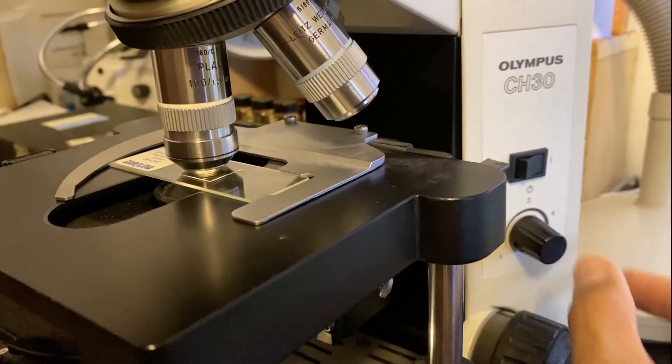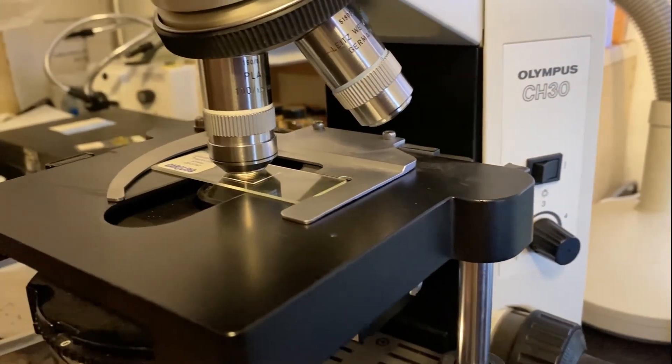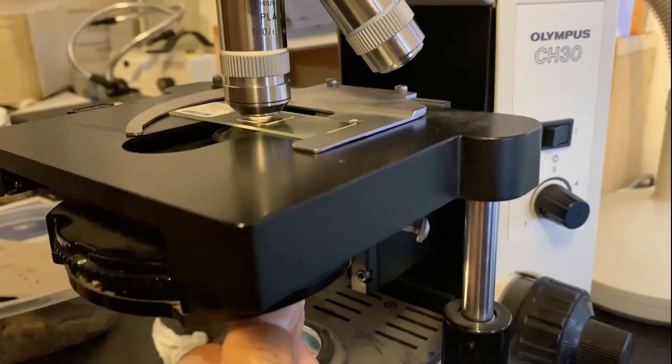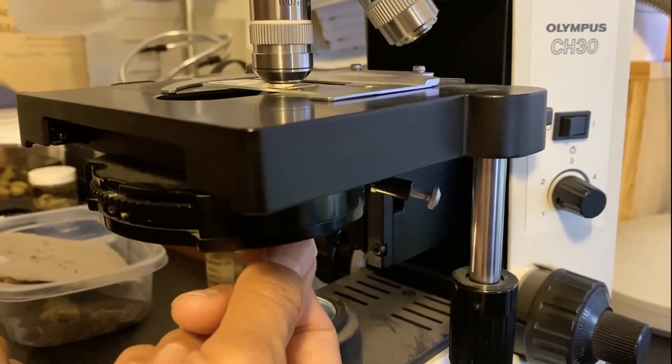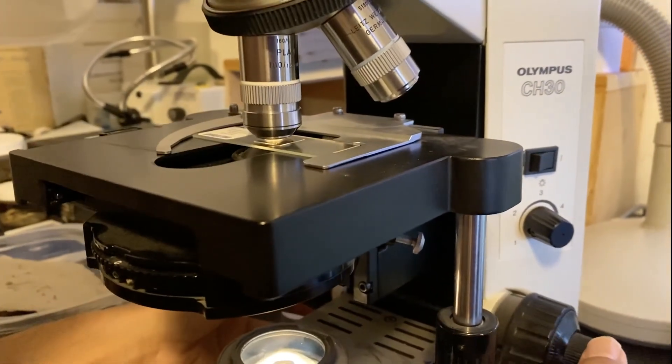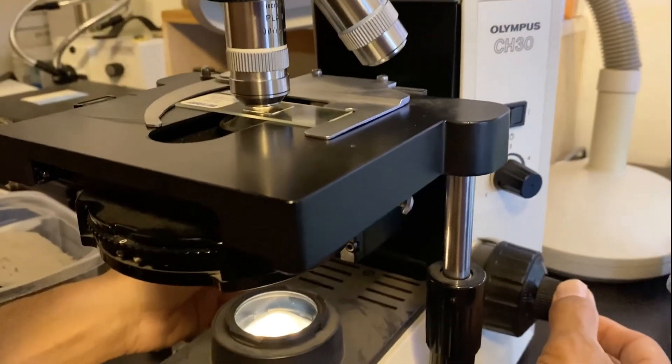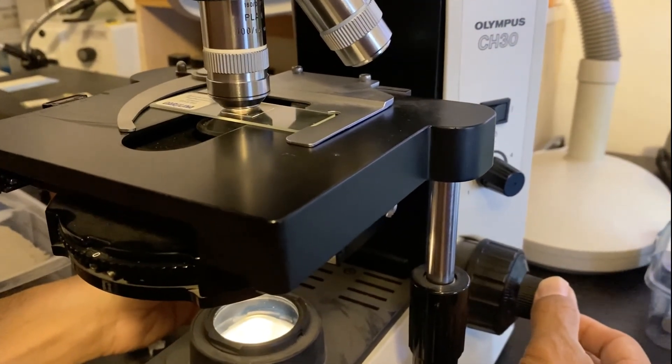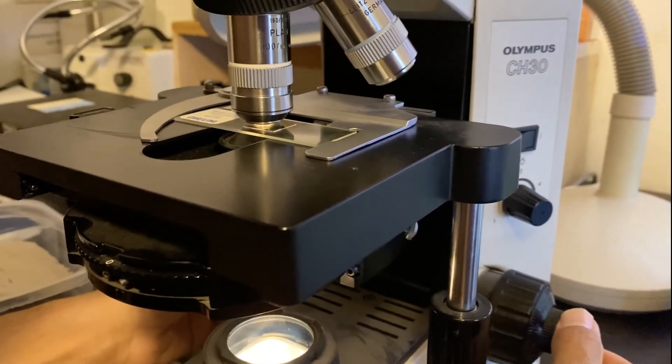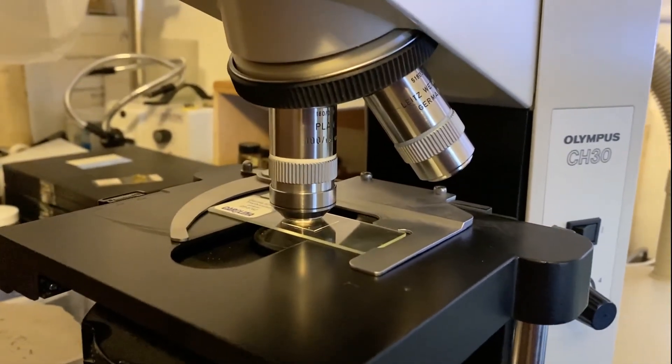You may also wish to use the light to bring a greater amount of light through the scope, or actually turn it down as the case may be, and also to adjust the iris underneath so that we can tune it just right to see the image as clearly as possible under oil immersion.